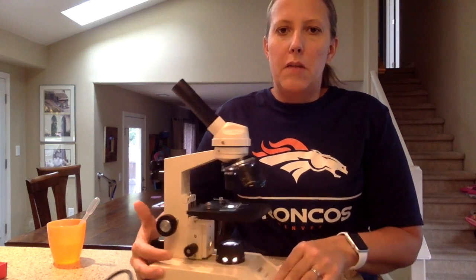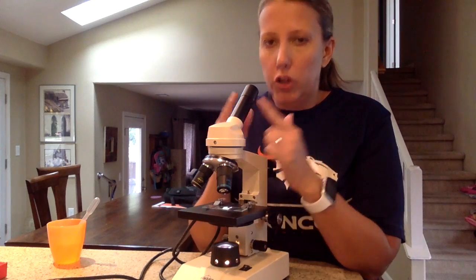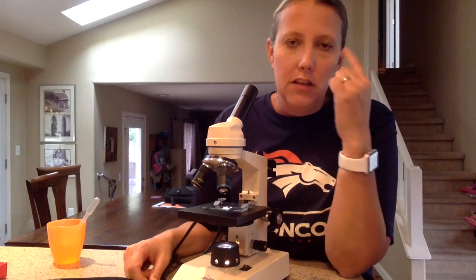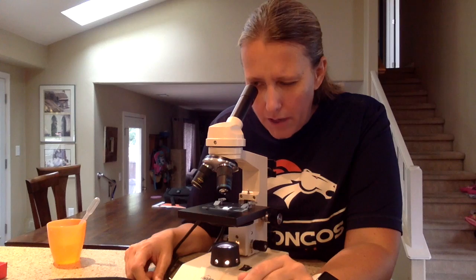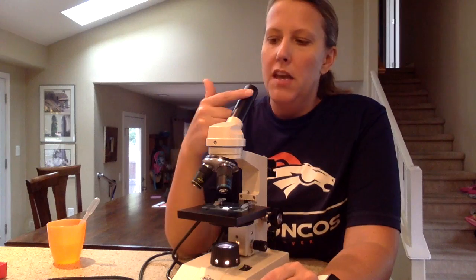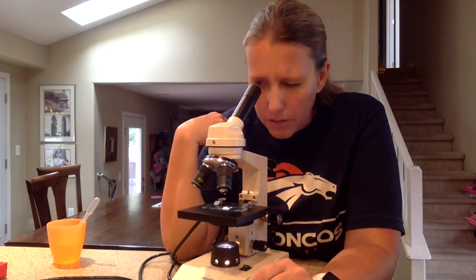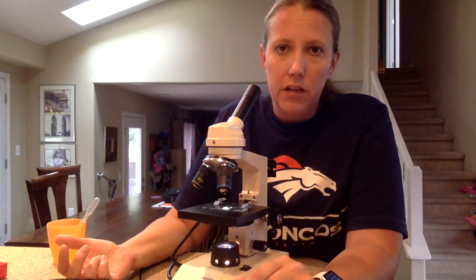At this point, you are ready to focus your microscope. You're going to look through the ocular with one eye — I like to close the other eye, some people leave them both open, it doesn't matter, whatever works for you. You're going to look through the ocular. You may see a dark black line — that's just a pointer, it's actually in the ocular, and if you turn the ocular you can change the way the pointer is pointing. You're just going to see a white blur, or maybe a colored blur, depending on your specimen.